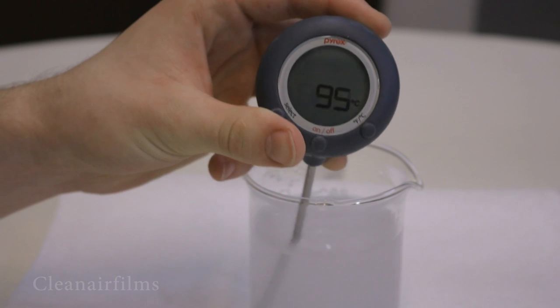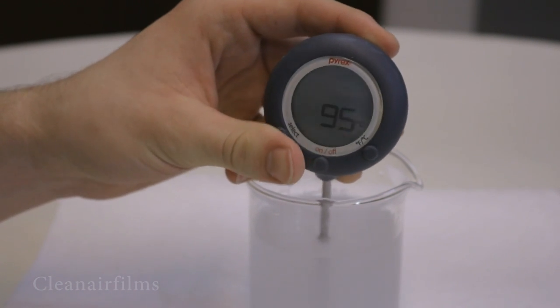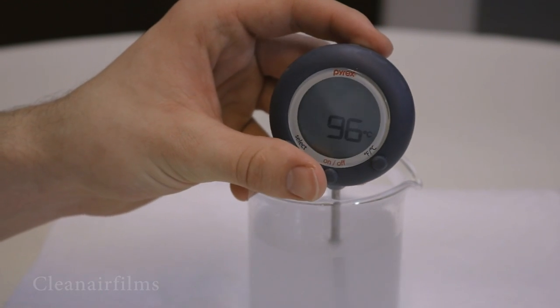The temperature has reached 95 degrees Celsius. That is very close to the boiling point of water. So what happened? It is important to note that no real chemical reaction occurred.